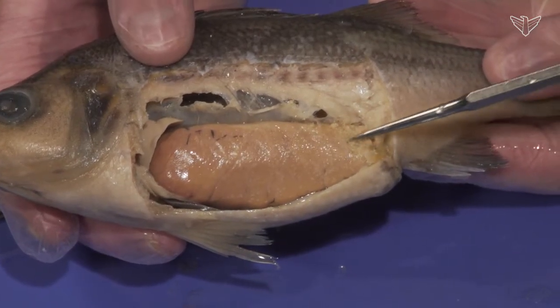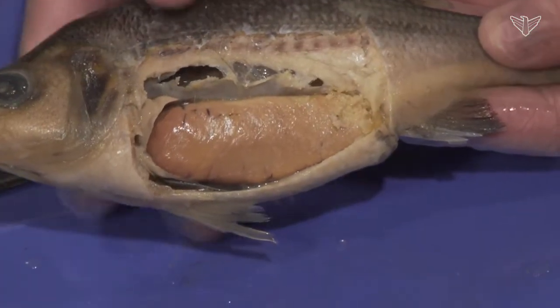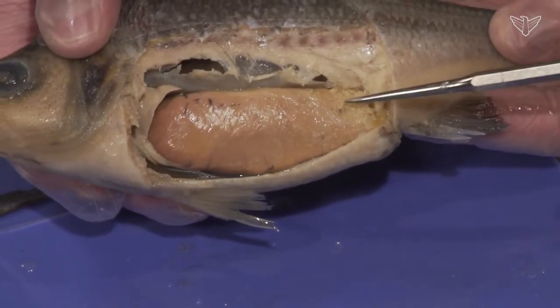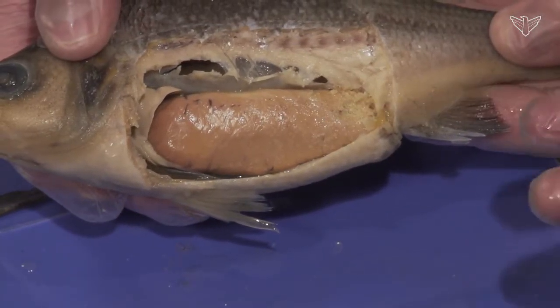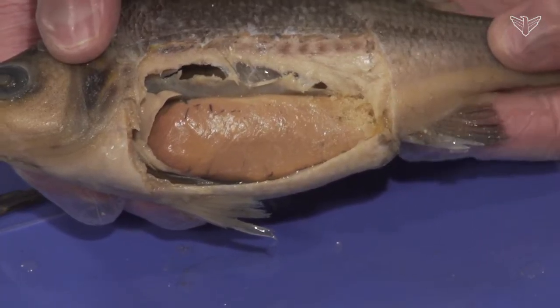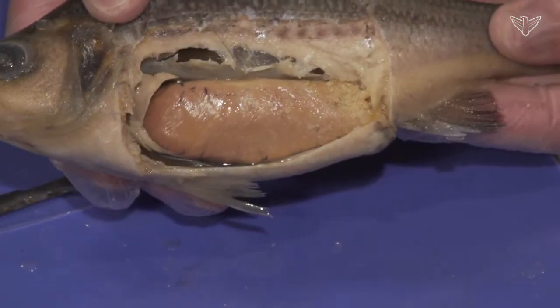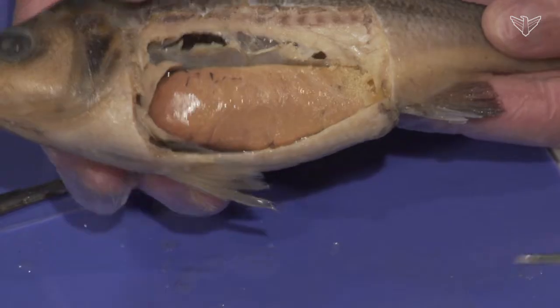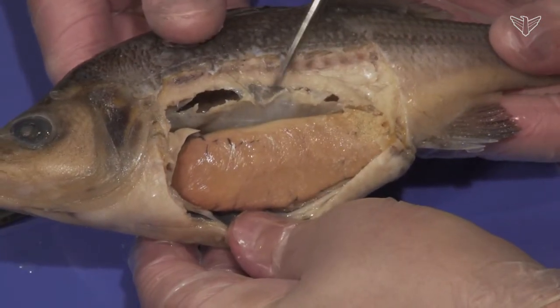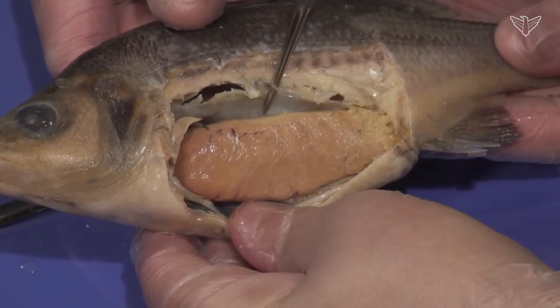You can see where we kind of nicked it — those tiny little structures. That's what made the belly enlarge. She was probably getting close to maturity. Each one of those tiny ones would develop into eggs, so these animals have tremendous reproductive capacity — they can produce thousands and thousands of eggs each. That would be released out of the cloaca.